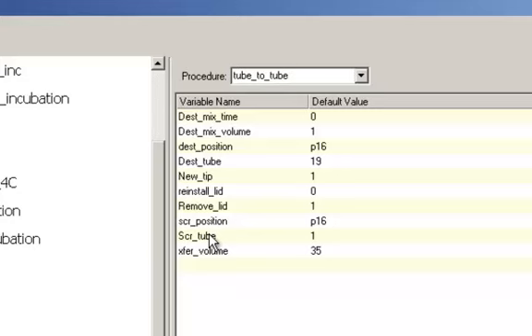If you tell it you're going to make the master mixes on the deck, have the instrument make them, it's going to put up a different instrument setup that has some P1000 tips, P250s, and I believe P50s, and it's going to choose the appropriate tip according to the volume that it has to transfer.